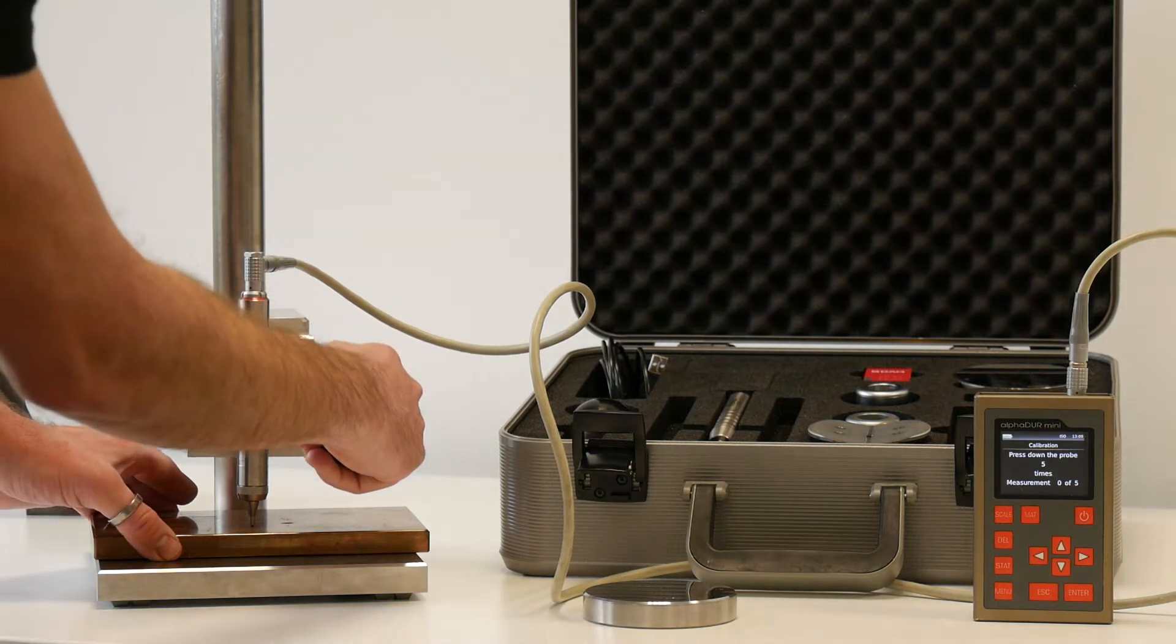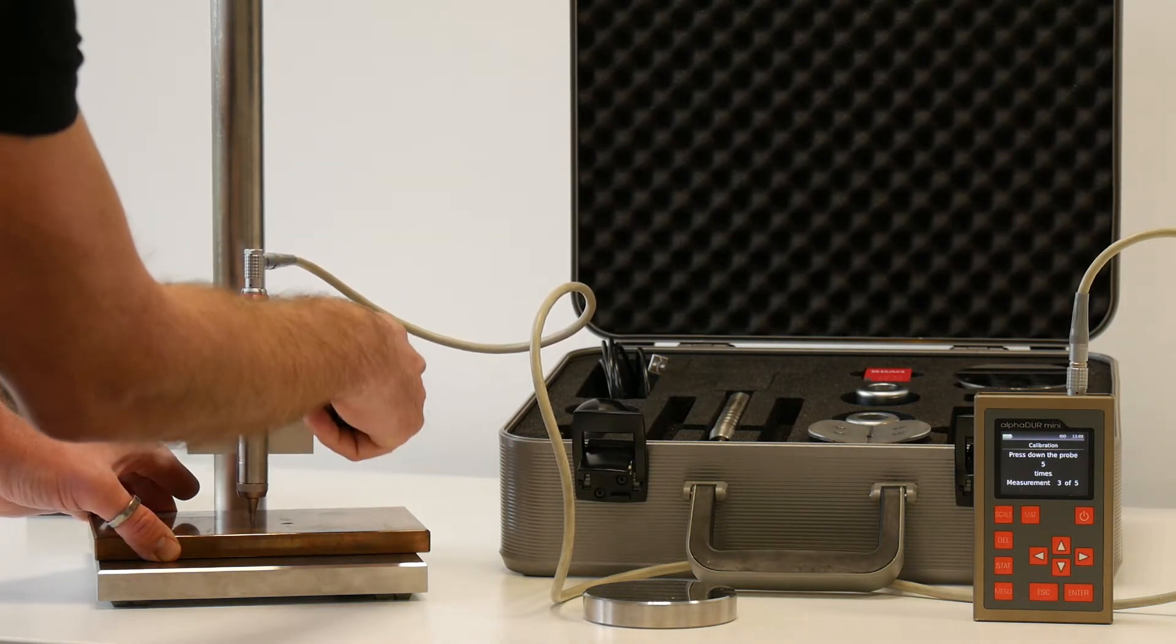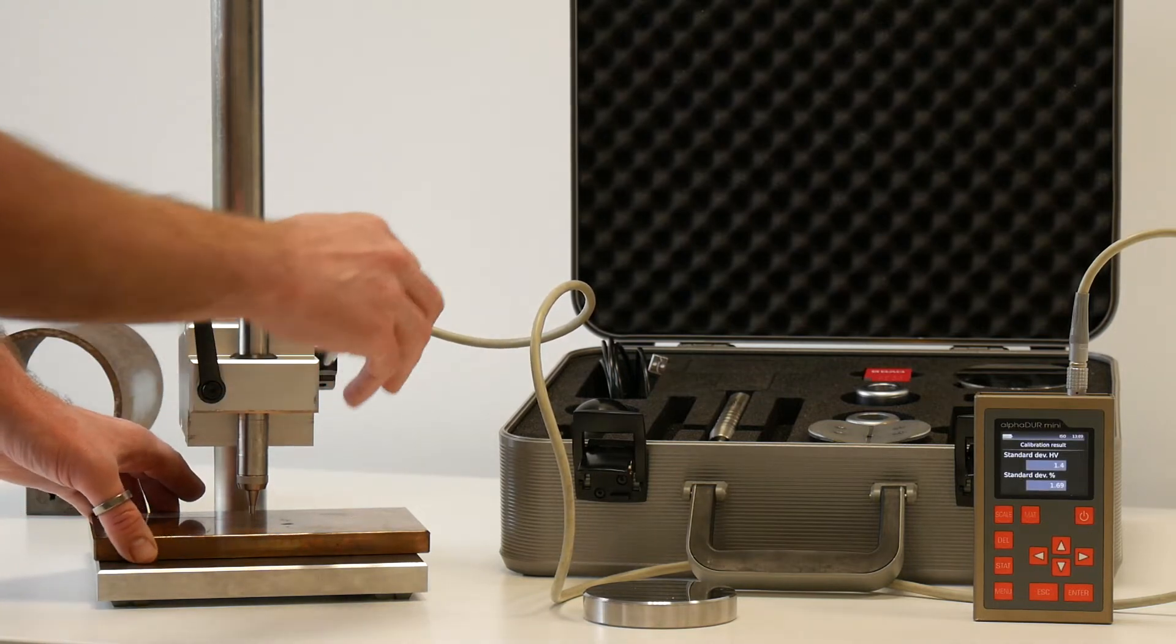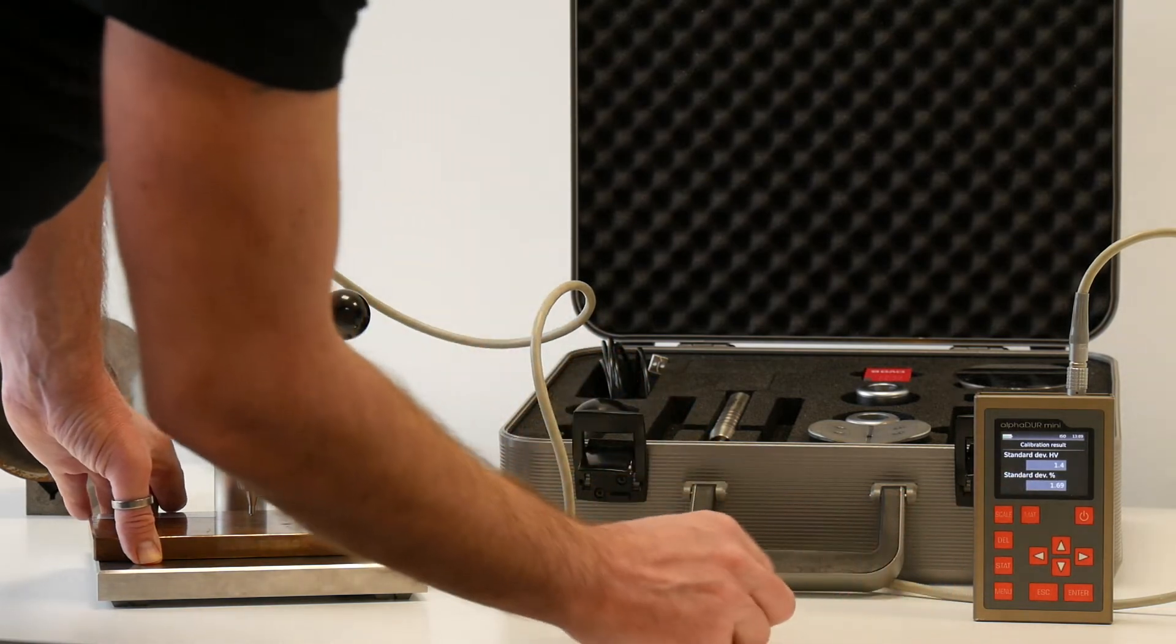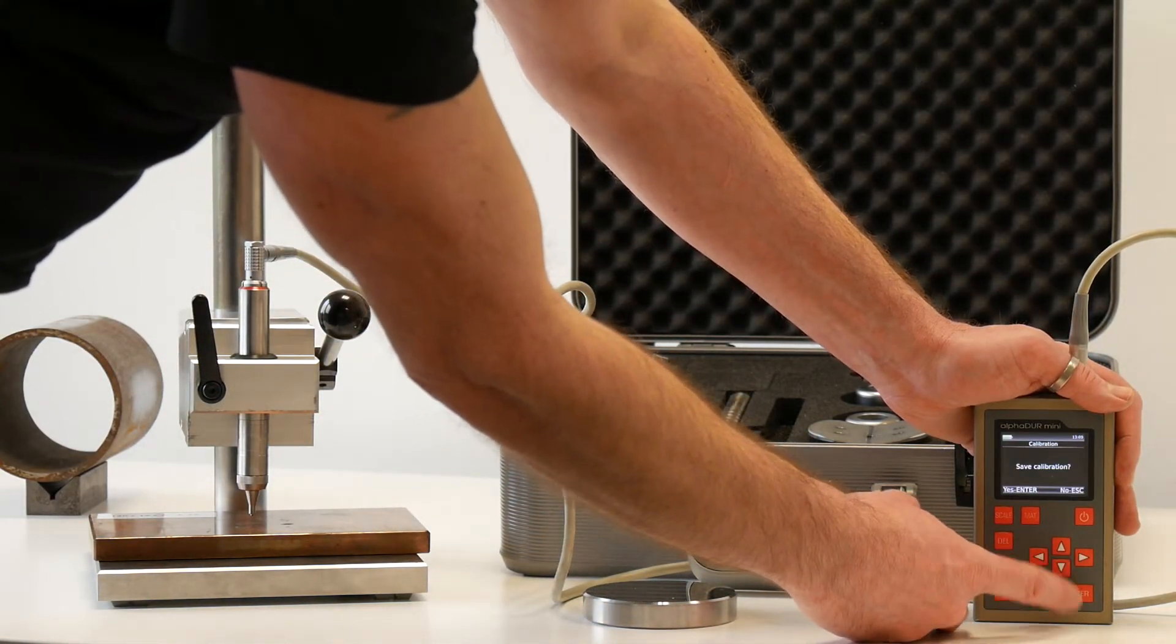Then we make 5 measurements on the copper sample. And if the statistics are good, then we can save this material calibration into the device.